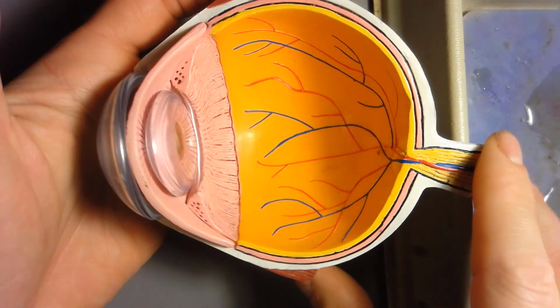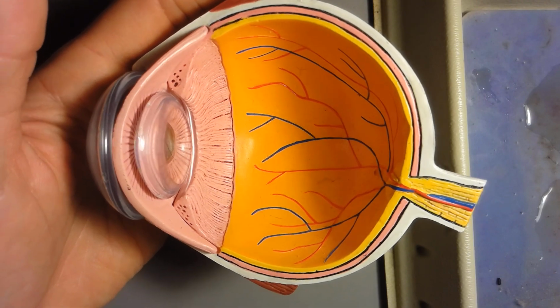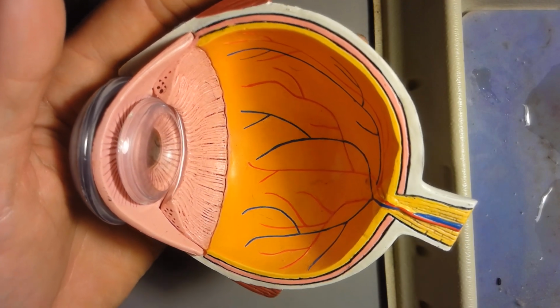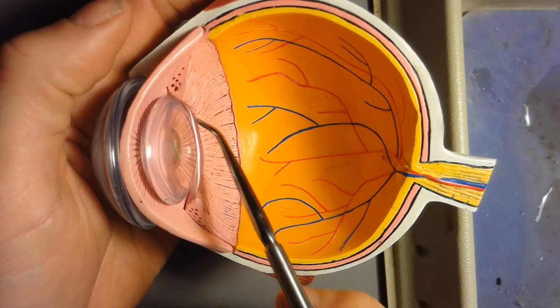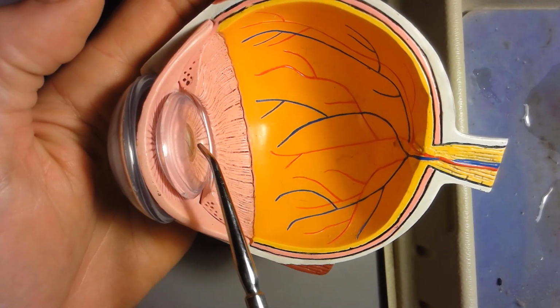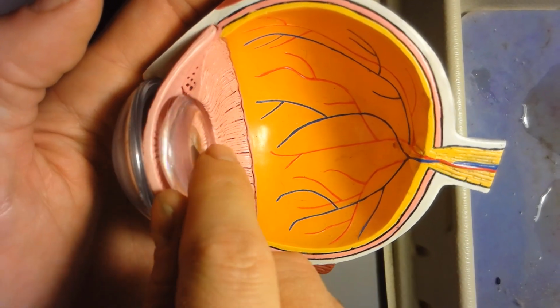Alright, so I'm going to flip this over here. Alright, so now you're looking inside the eye. And so the first one on the list, the aqueous humor, you're not going to see the aqueous humor on an eye model. It's a fluid, so you'll see that on a real eye. So I'm going to go down to the next one, the lens. The lens is right here. So it's internal. So again, comparing it to the cornea, this is the cornea right here. The lens is behind the cornea. This can be removed like that. So this is the lens right here.